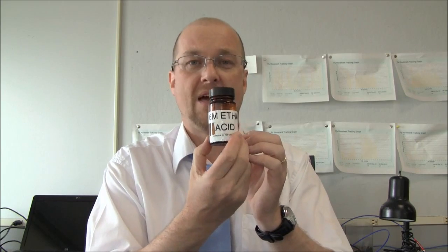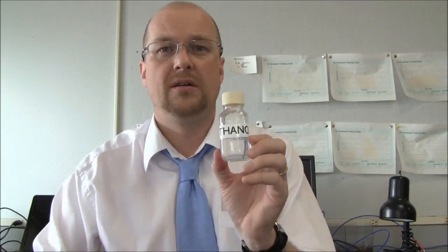Before I do that, I'm going to run through my 6 molar ethanoic acid, my ethanol, and ethyl ethanoate through the machine to see where their peaks are going to be.